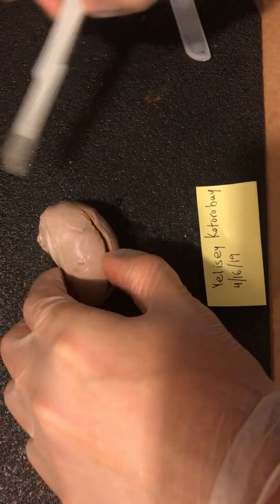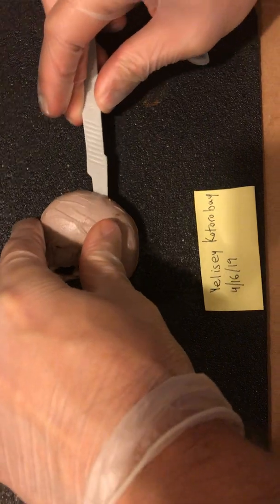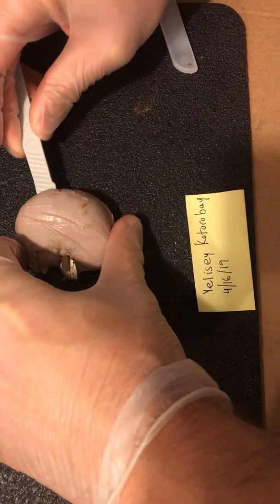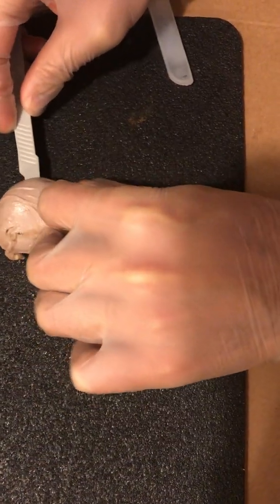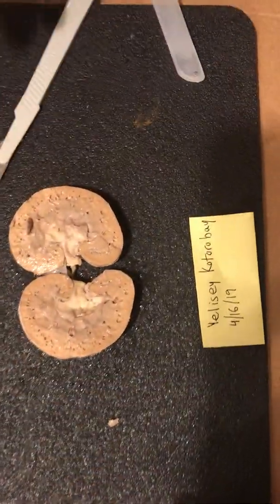A little more. Alright, and the moment of truth. Perfect.